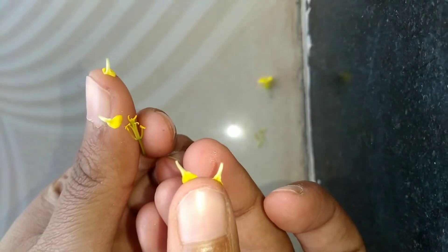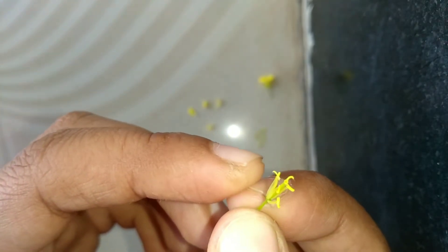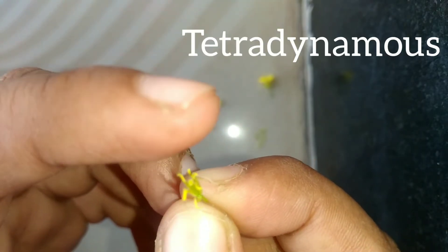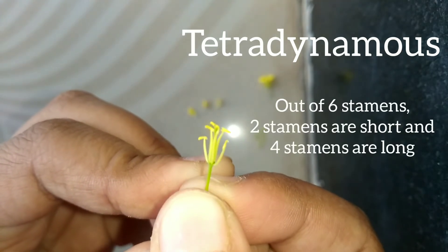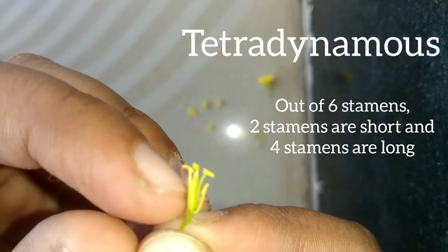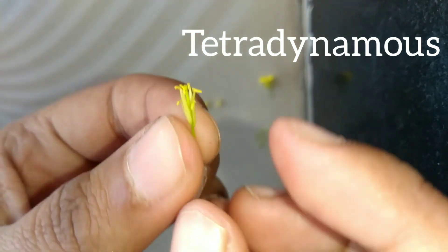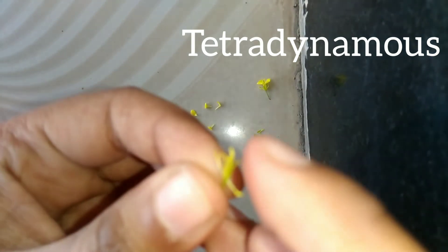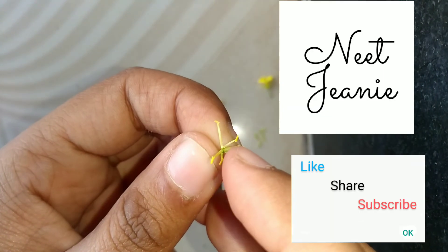The flower is very small. If you observe carefully, you can see that two stamens are short and the other four stamens are long. This type of condition is called the tetradynamous condition, in which out of six stamens, two stamens are short and four stamens are long. These are the two short stamens. This condition is found in mustard.